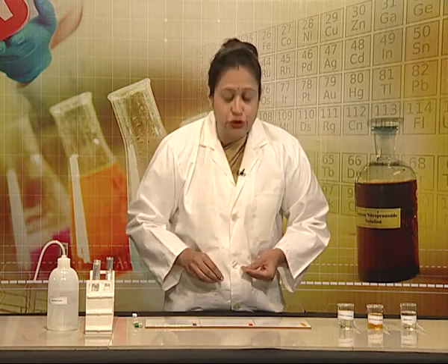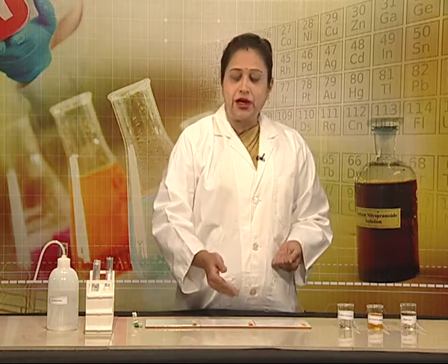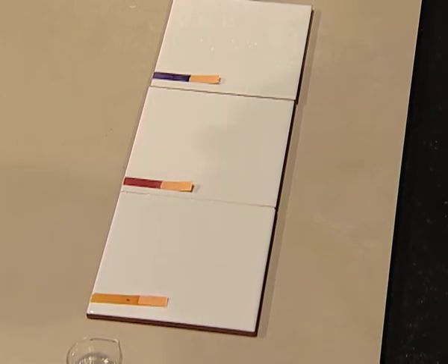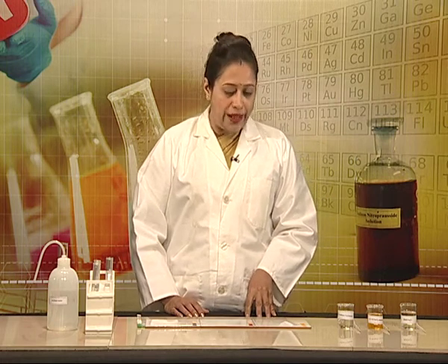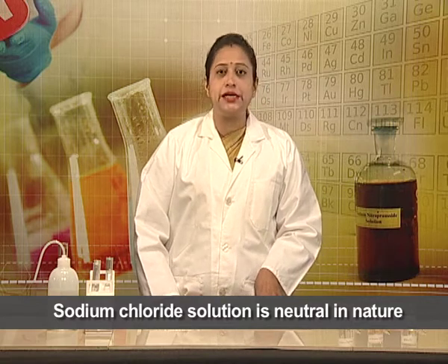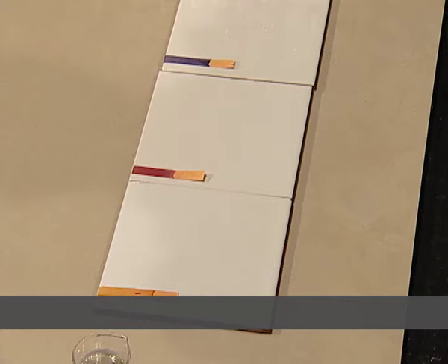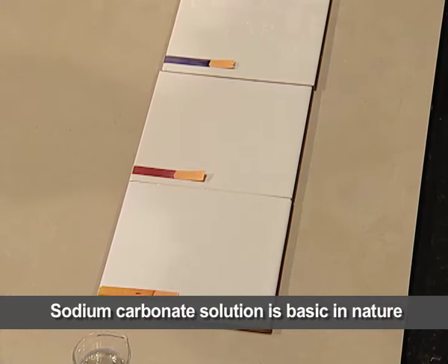So the 0.1 molar solution of sodium chloride has pH 7, that of ferric chloride has pH around 2, and that of sodium carbonate has pH around 10.5. What can we say about the nature of these solutions? The sodium chloride solution, which has a pH of 7, is neutral in nature. Ferric chloride, with a pH value of about 2, is acidic in nature. And sodium carbonate, with a pH value of about 10.5, is basic in nature.